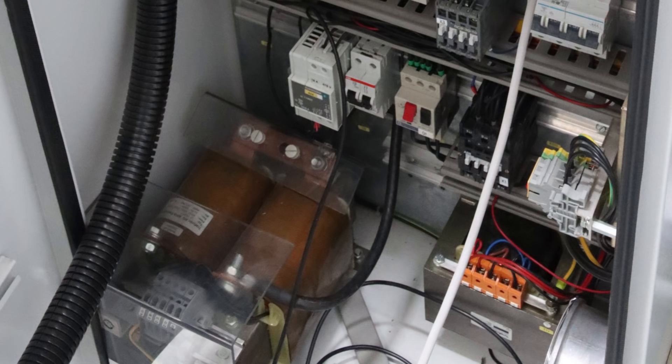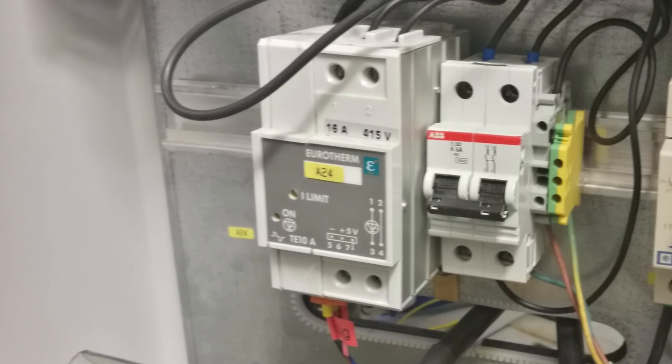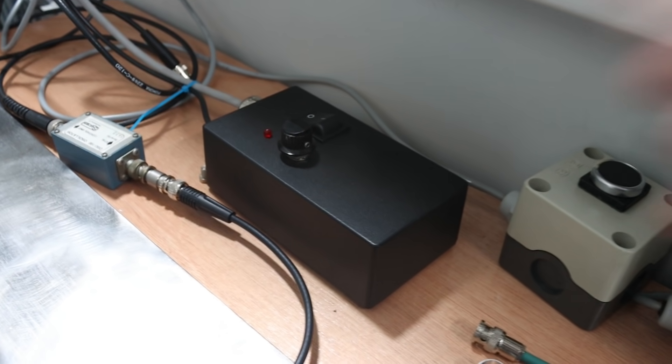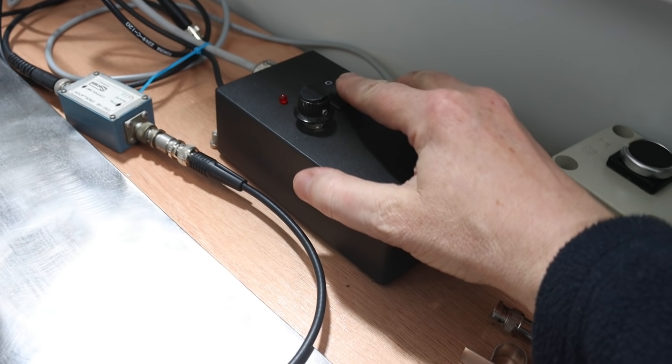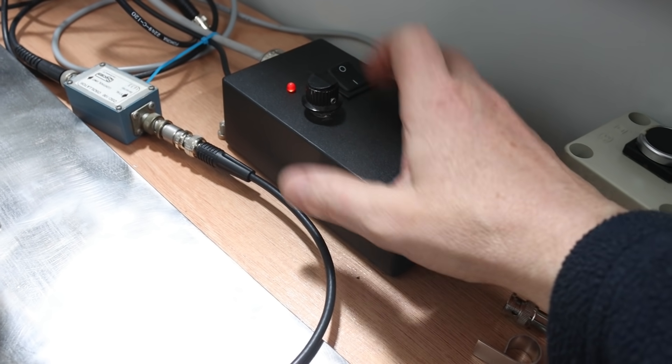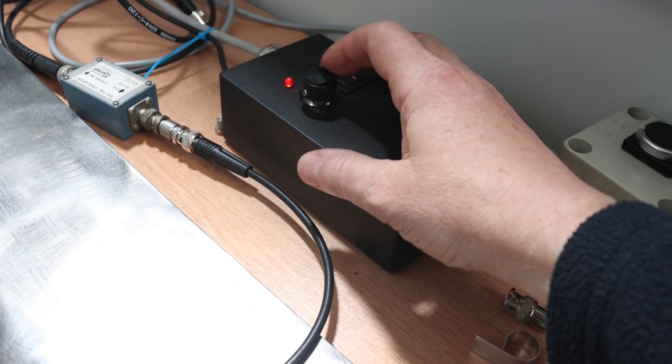As an electric current source, I used a low voltage, high current transformer and the transformer current is controlled by a thyristor. I also made a small remote control to be placed next to the chamber to control the thyristor while being able to look in the evaporator chamber.